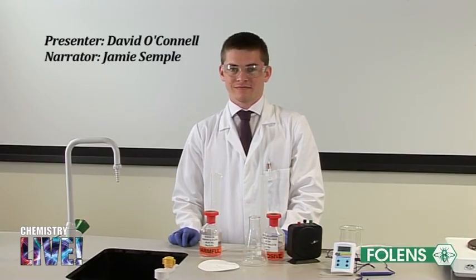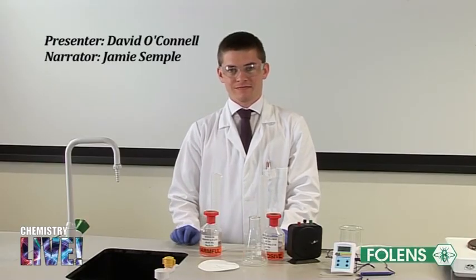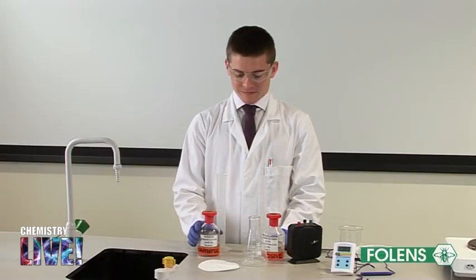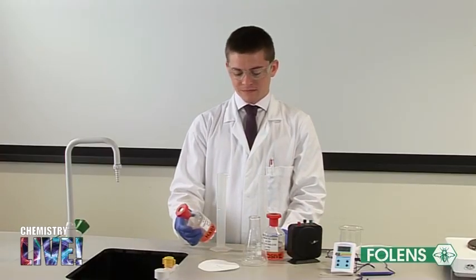Experiment to study the effect of temperature on the rate of reaction using sodium thiosulphate and hydrochloric acid. In this experiment, we used the same chemical reaction studied in the previous experiment.